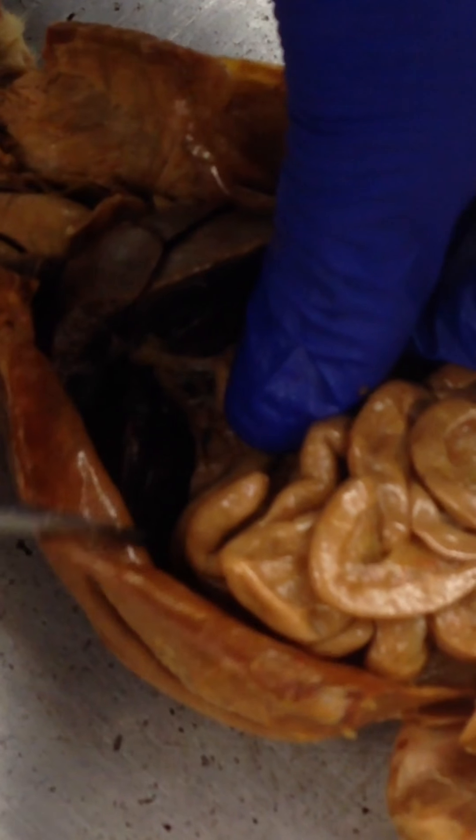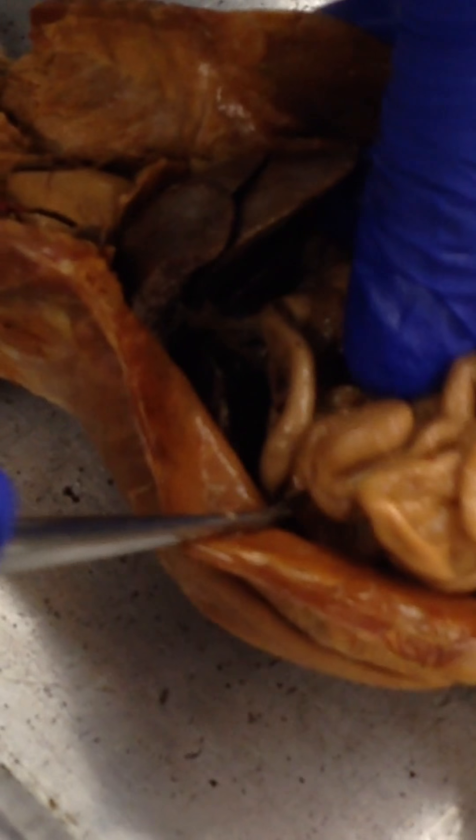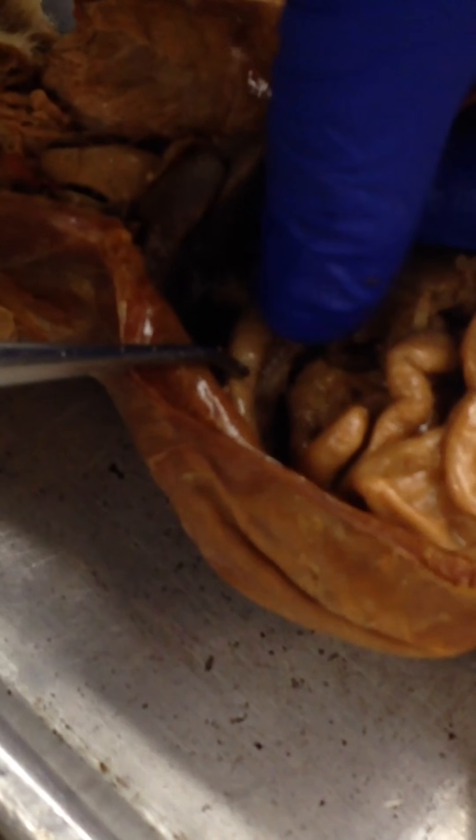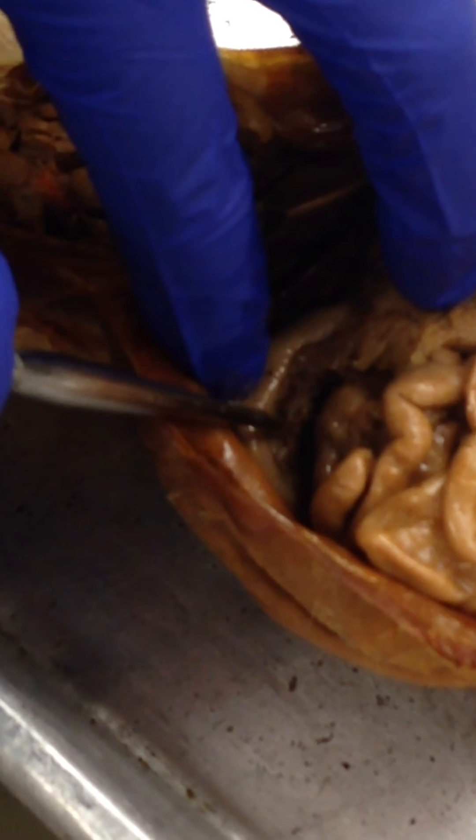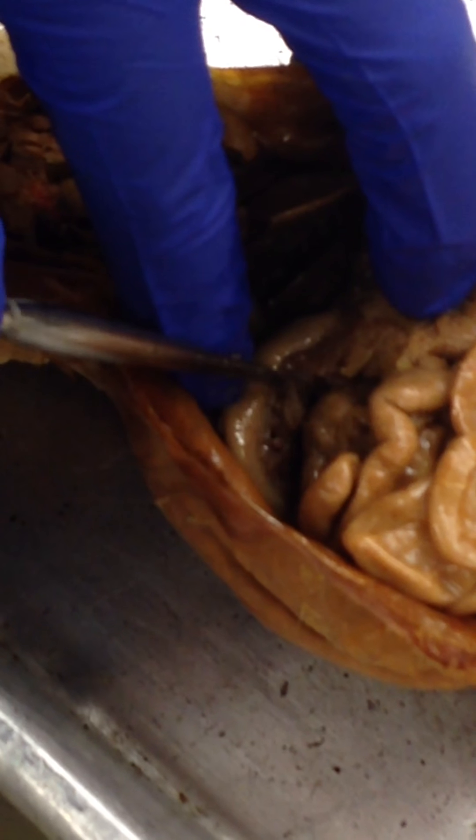The pancreas is right under the duodenum. It's right here — the brown stuff. So here's the duodenum, and then here's the pancreas — it's darker brown.